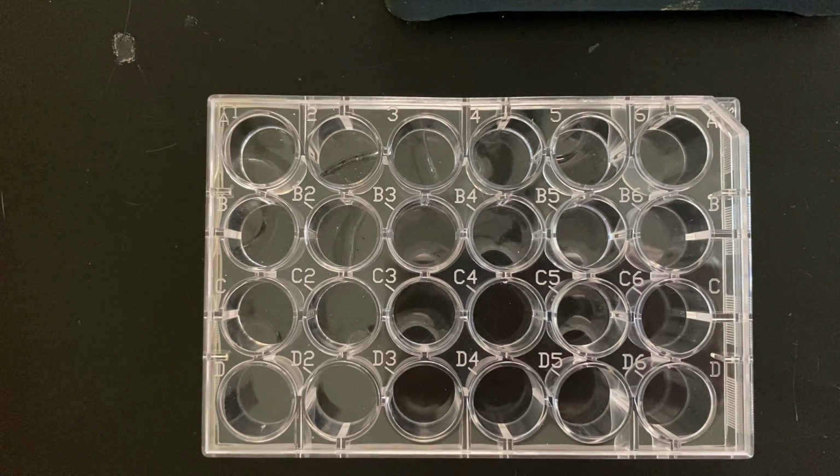So first off, we're going to react everything with sodium carbonate. So we're looking for a reaction as indicated by a precipitate forming. A precipitate is a solid product that forms. So we're going to look for really the solution getting cloudy.